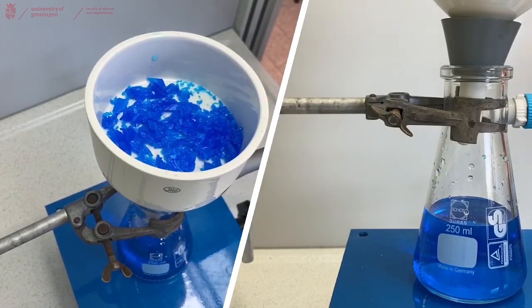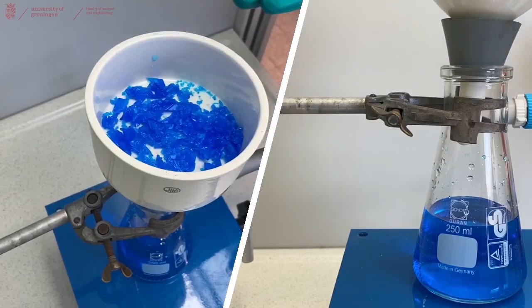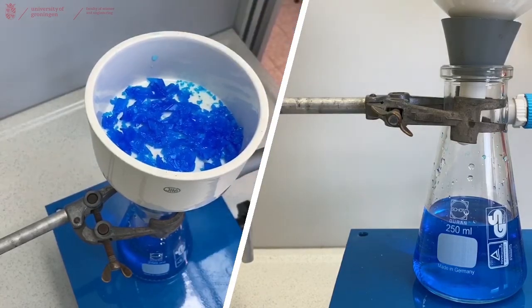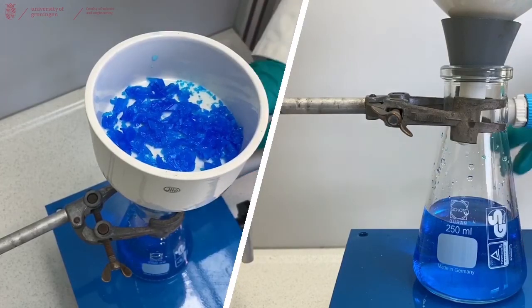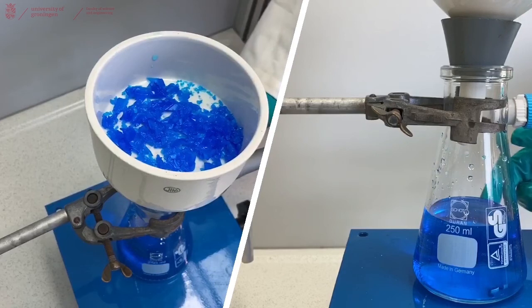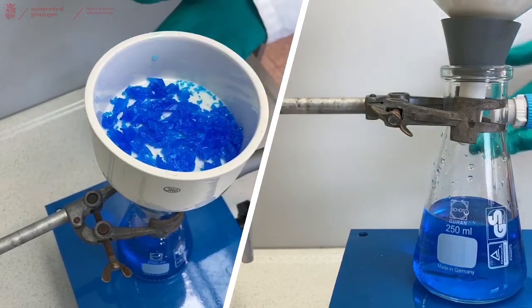Now that we have rinsed our crystals on the filtration paper, we can leave it drying under a small vacuum or in air. But please make sure to remove your liquid from the flask in the bottom, because with a small vacuum this will evaporate over time and we don't want that.